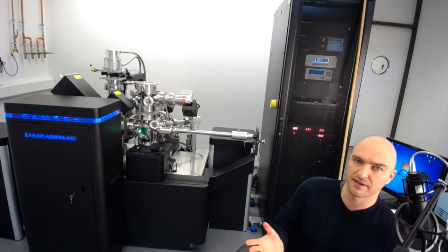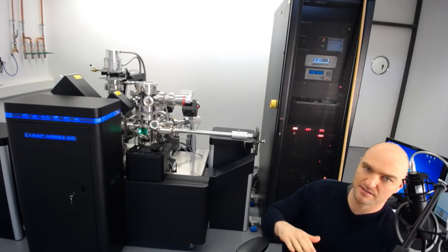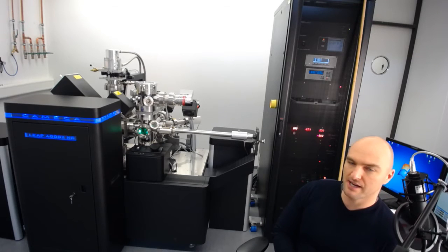In the first video, I'll show you what the Atom Probe looks like, what the different parts are, and what you have to remember about them. In the second video, I'll show you how to prep a sample for insertion, which always means working very, very clean. Working in ultra-high vacuum also means the system is hermetically sealed to the outside — there are no mechanical feed-throughs. The only way to feed through motion is through magnetic coupling.